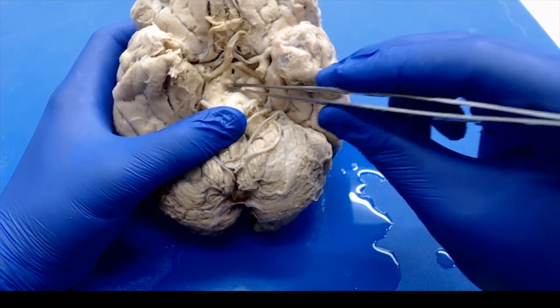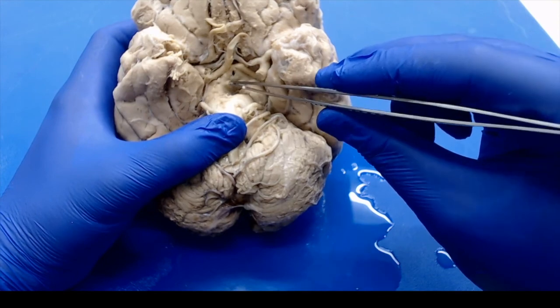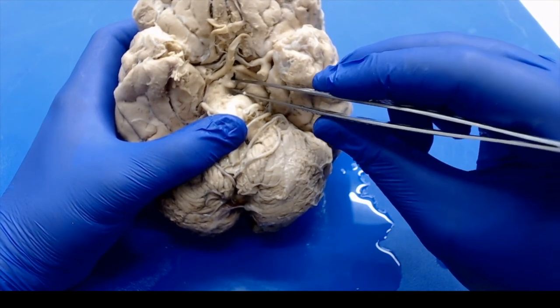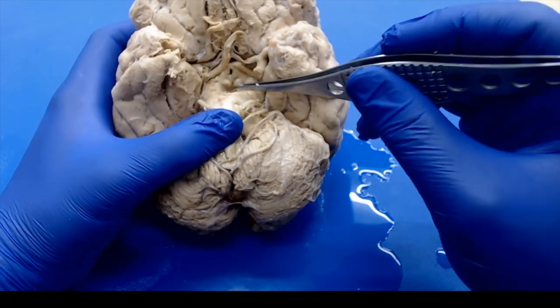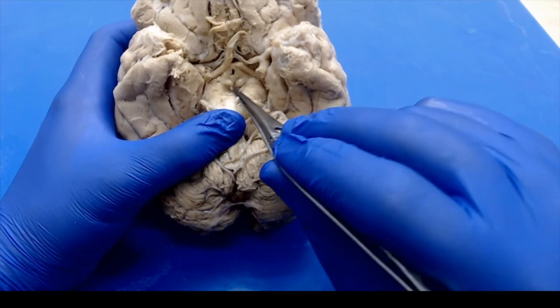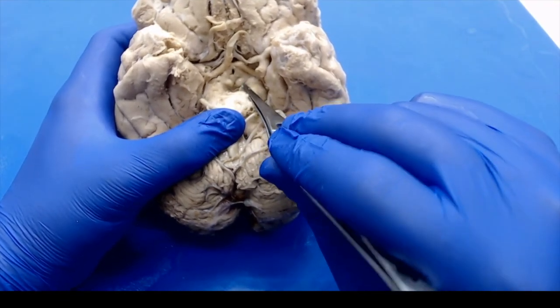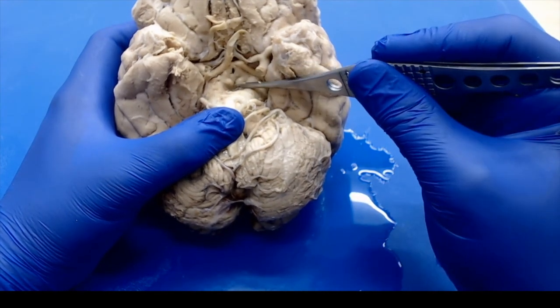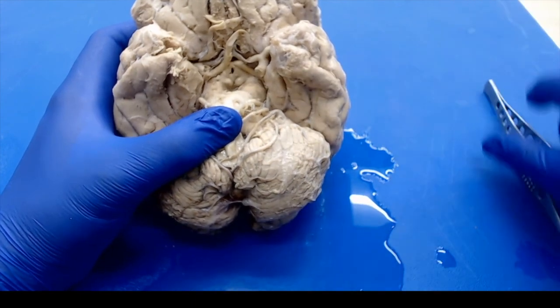These are two bodies that are just anterior to the brainstem here. So once you find your midbrain, just go anterior to that. You'll see these two little nubbins that are your mammillary bodies. Those are going to be your central point for cutting the brain. You want to find those, and we're going to make our first cut through those particular structures. So ideally, you're just going to go anterior to your midbrain. So I'm going to get my other brain, and we'll start doing some cuts.